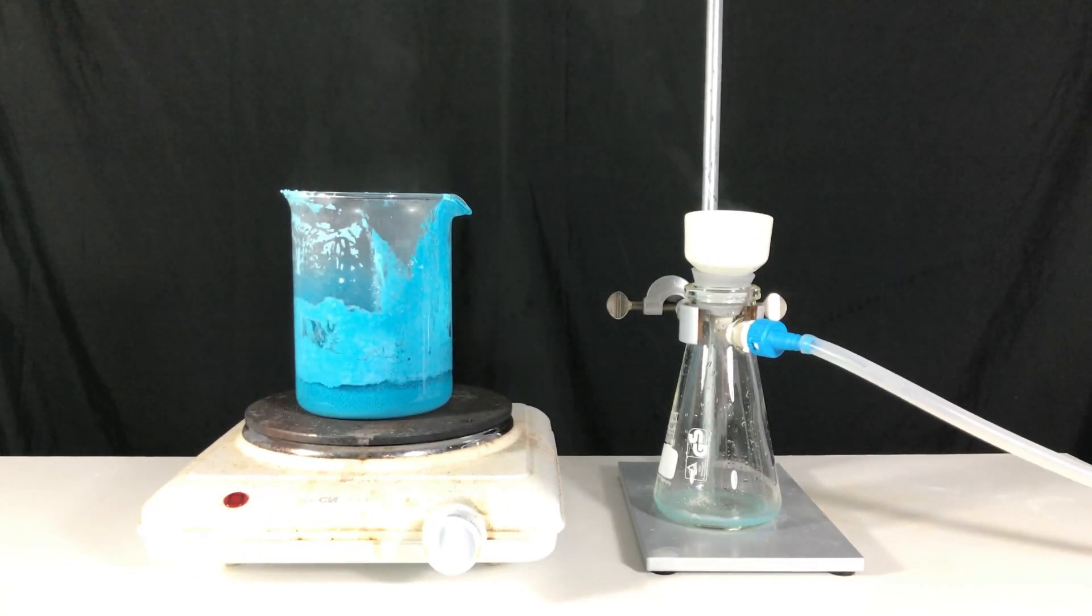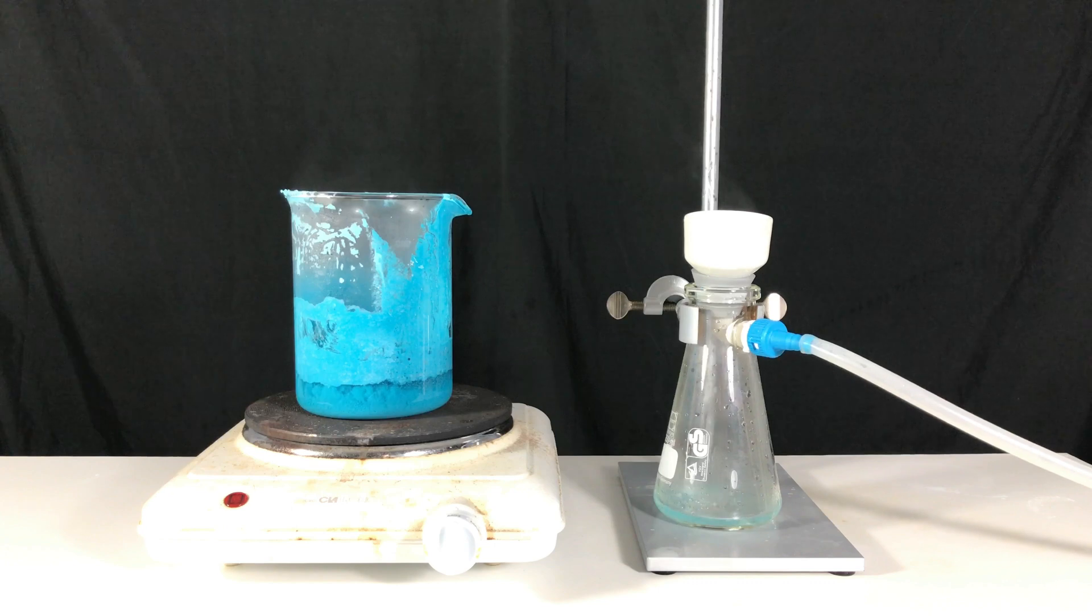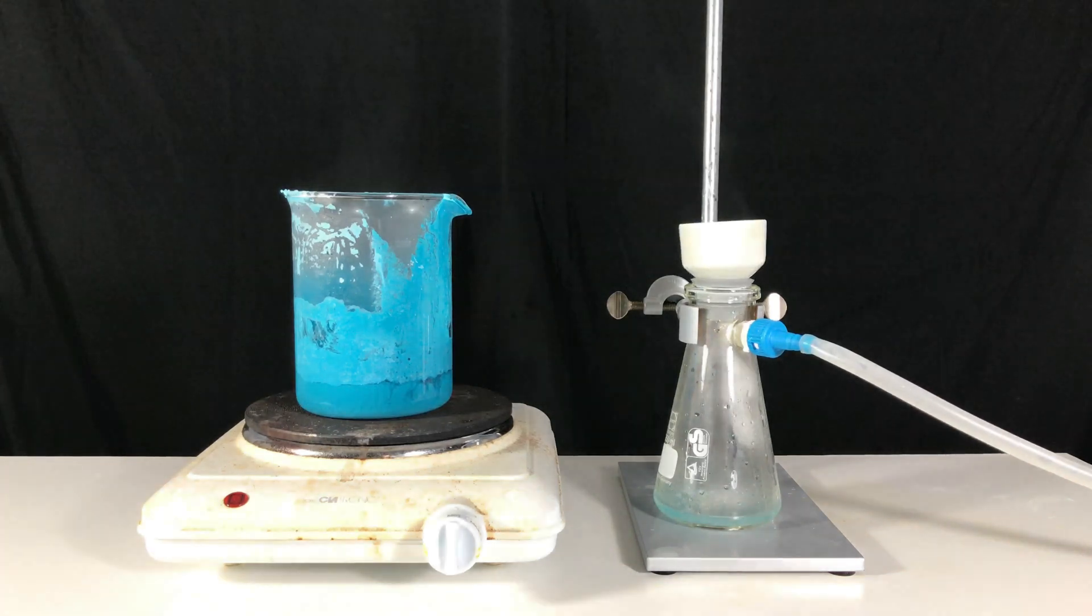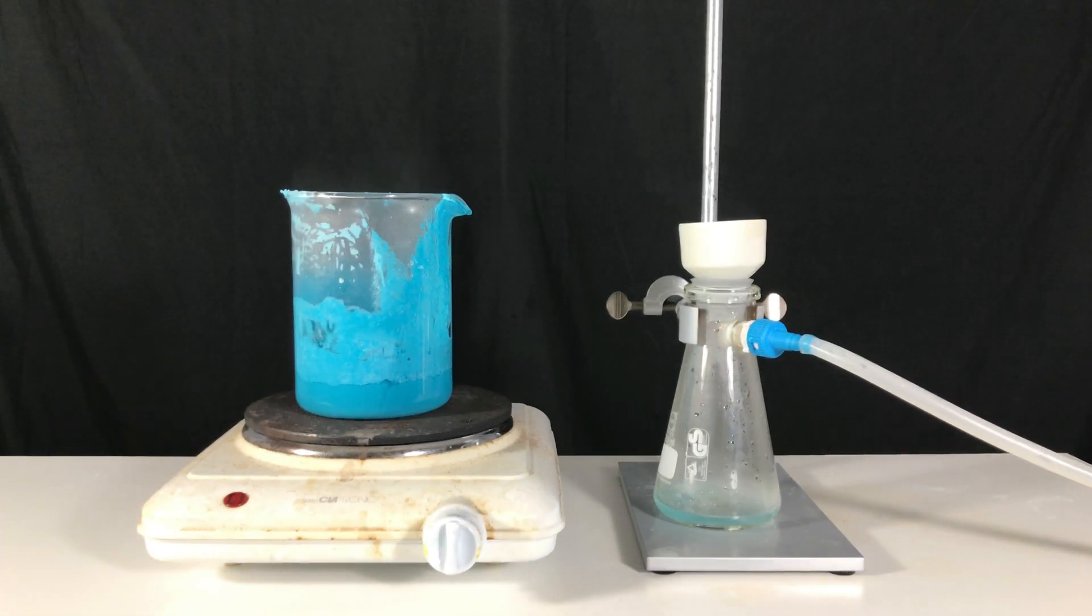Sodium sulfate is more soluble in hot water than in cold water. Therefore the filtration is way more effective when our solution is still hot.